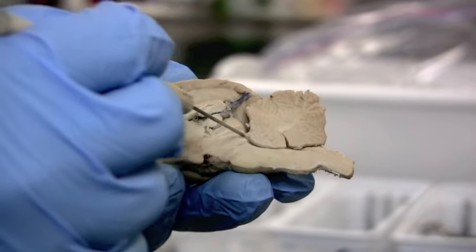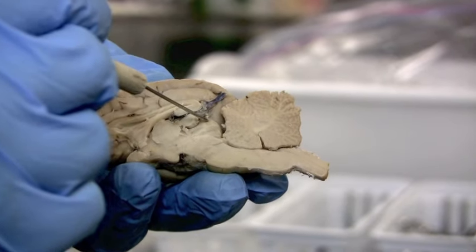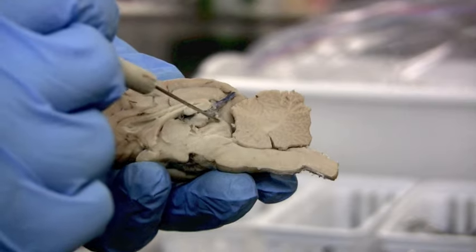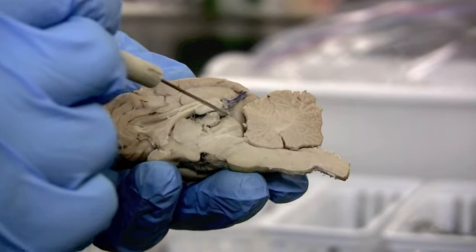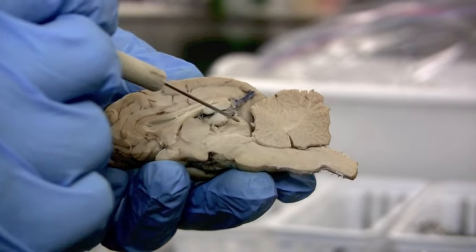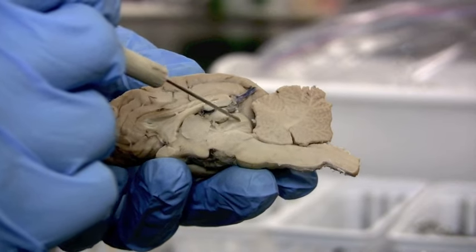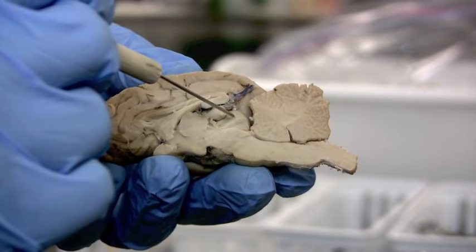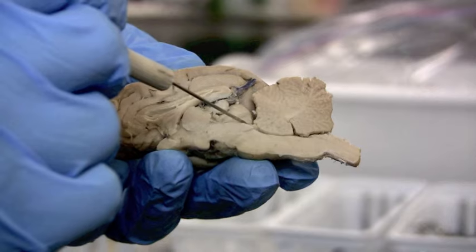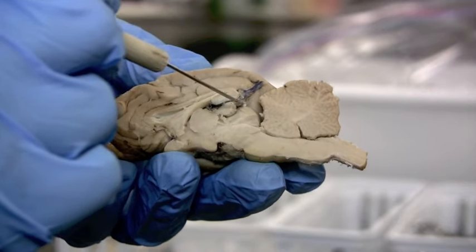As the canal comes up, you can see this is where the corpora quadrigemina are in this mid-sagittal view, looking at the center cut. This is the superior colliculus and the inferior colliculus — that's the singular version of colliculi.